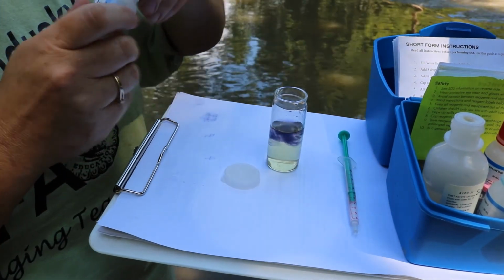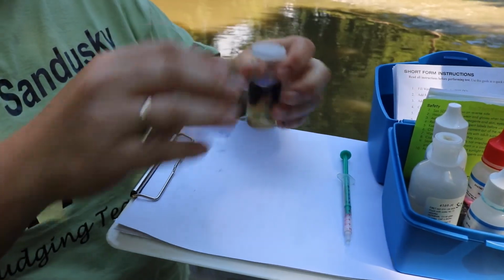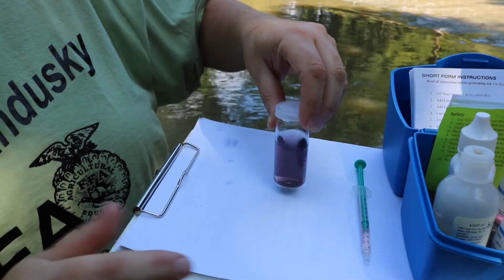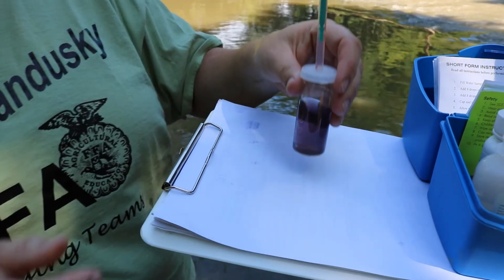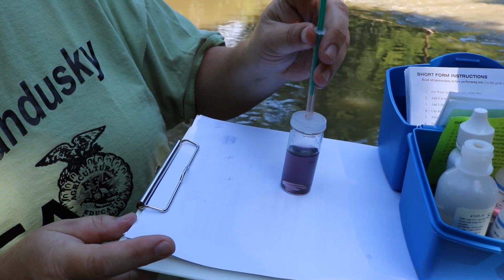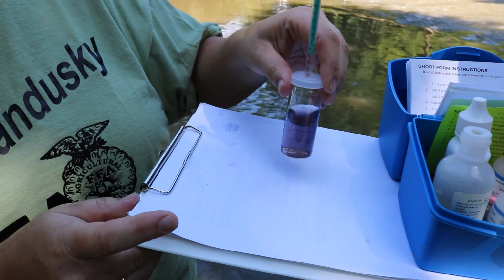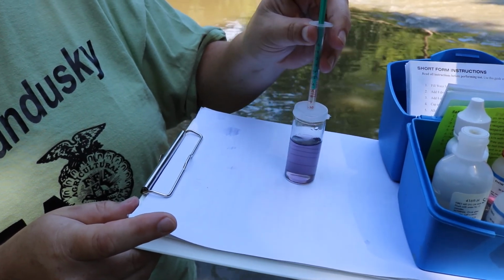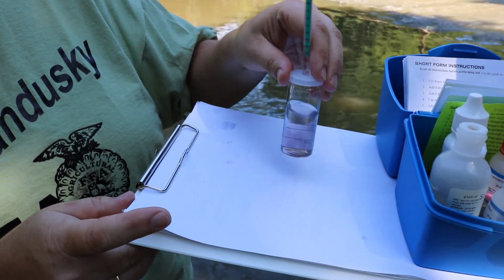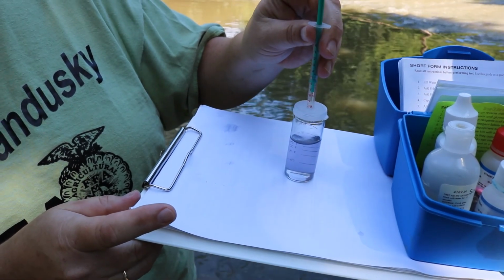So this is all chemistry. Swirl that around, get a blue-purple color, and we want to go just to clear. If we run out of thiosulfate, we can fill it again. We just have to remember to add 10 to whatever we use. You see how quick it can sometimes turn. So we're using different chemicals in order to indicate what our levels are. Pretty fascinating, really.